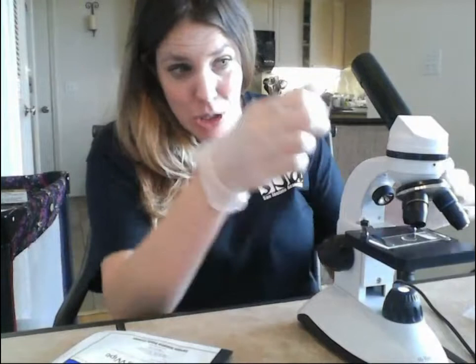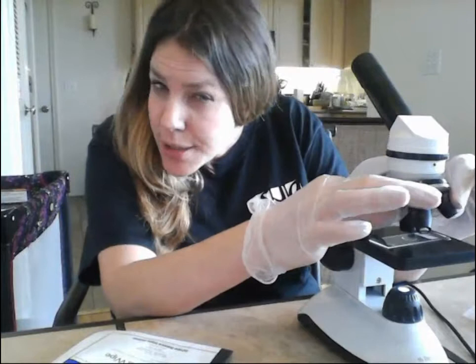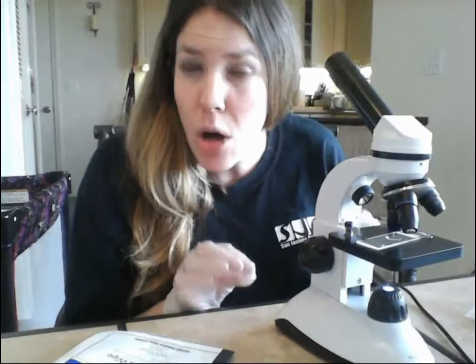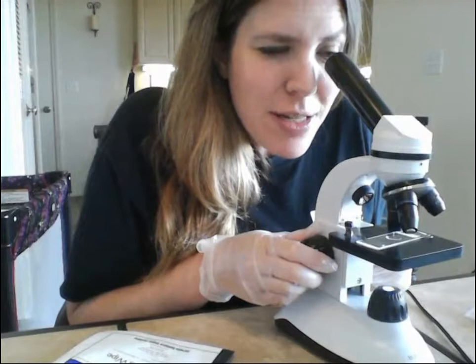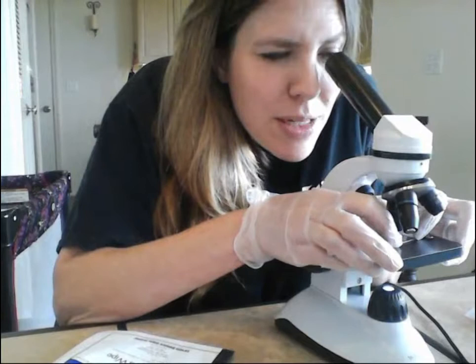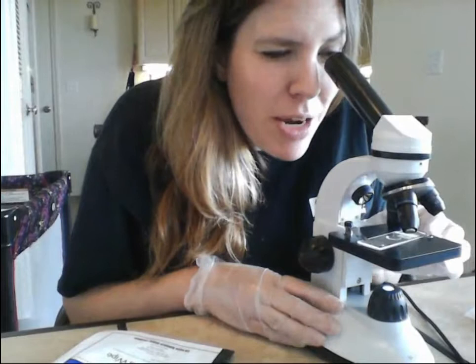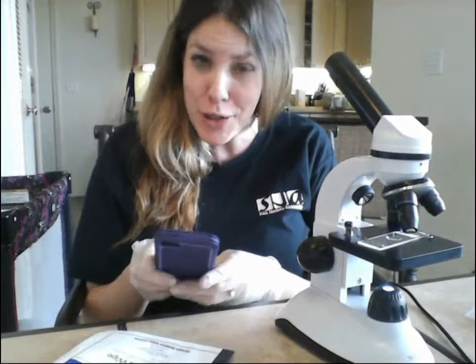Once you have it in focus, turn the objective clockwise until you hear a click for the 10x objective — the one with the yellow ring. At this point your specimen should be parfocal, meaning almost focused. You shouldn't need large adjustments, just fine adjustments and maybe the light. Make a fine adjustment, and notice it'll look a little fuzzier as you go up in magnification — the edges of the E start getting fuzzy. Center it a bit better and adjust your iris diaphragm to get the image you want.